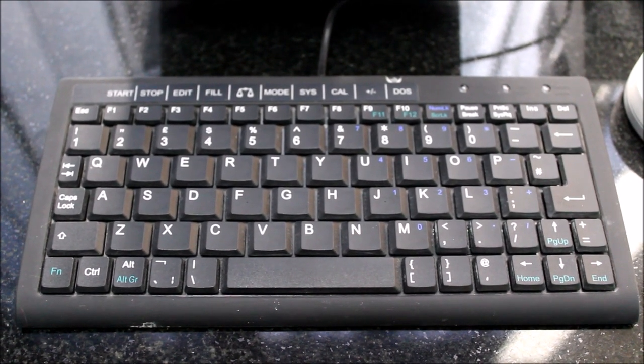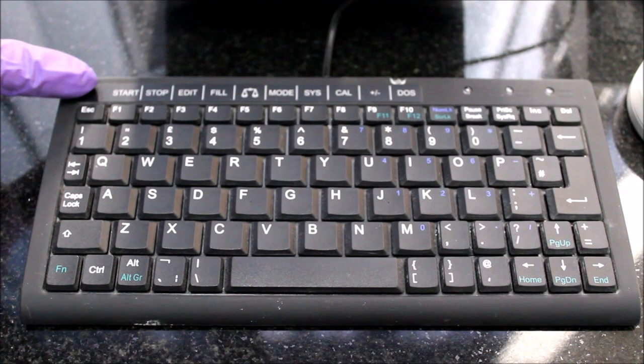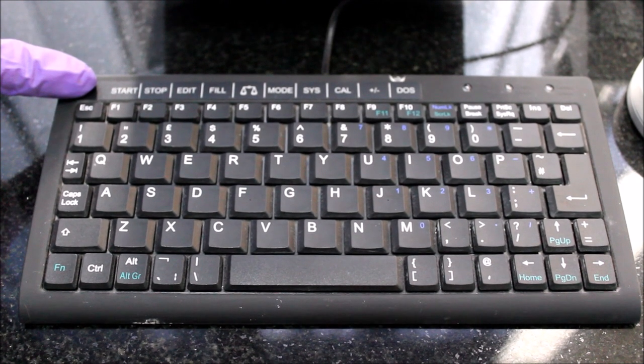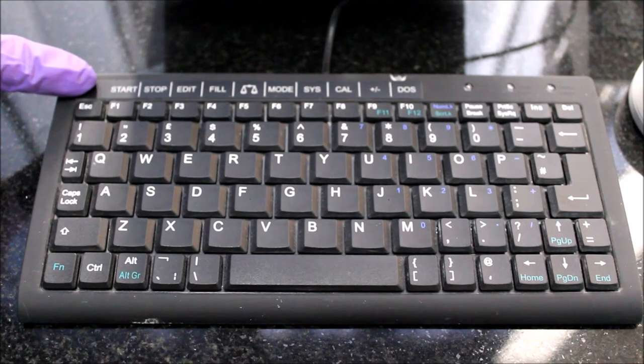As you can see, the function keys above correspond to the various commands of titration, so you can simply click on the appropriate key to perform the desired function.